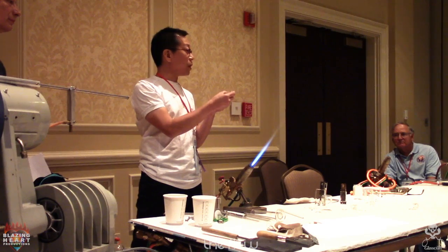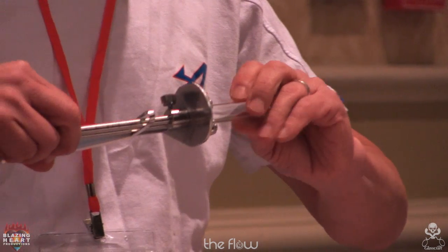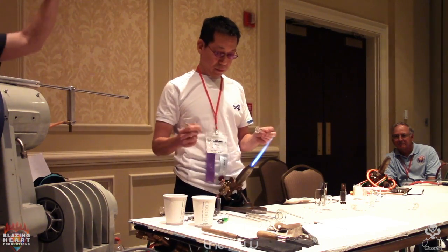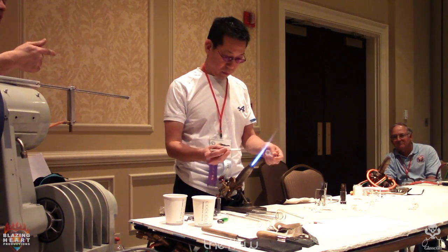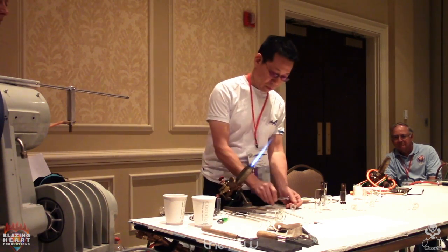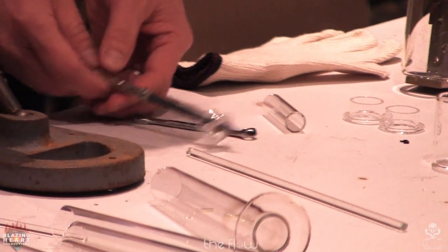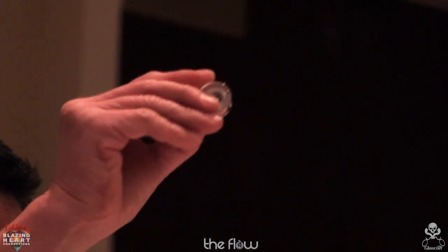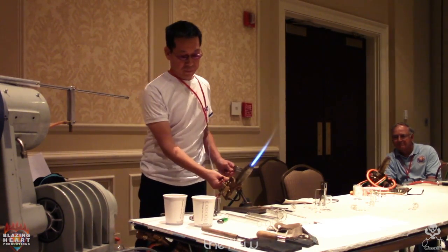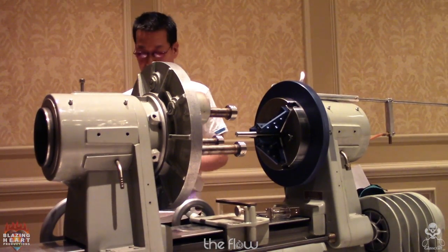This has been ground. Now he's going to use his internal scoring cutter to cut the flange down to length. It has a little rolling wheel on the shaft, and it scores the tube on the inside. So you apply heat to the outside, and it cracks off very nicely. That edge is clean and ready to use. It's the same process we did with Tsuyoshi's piece. You don't have to do any additional processing on the edge. This cutter tool is a nice way of getting consistent cuts for production runs. You set it once, slam a piece of glass in, cut, and you get 20 pieces within a fraction of a millimeter of the same length.